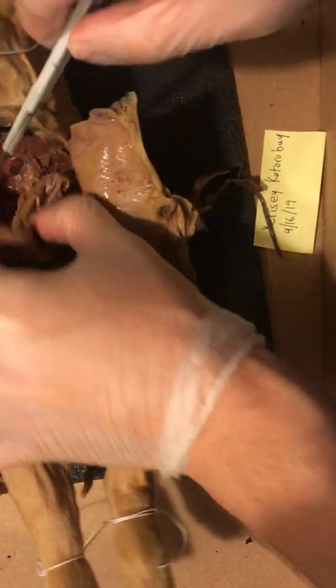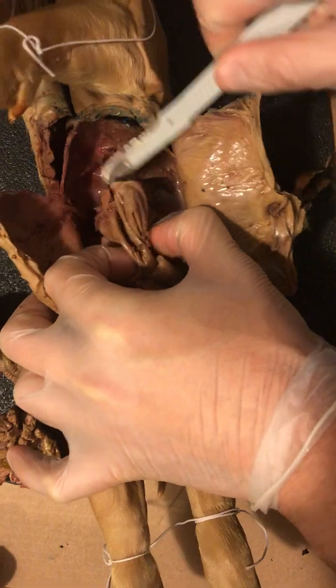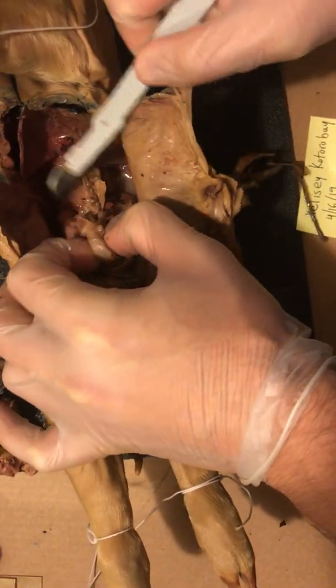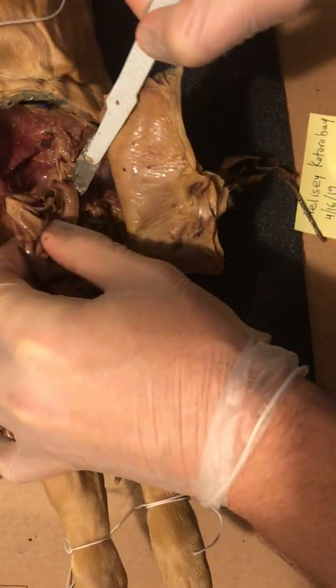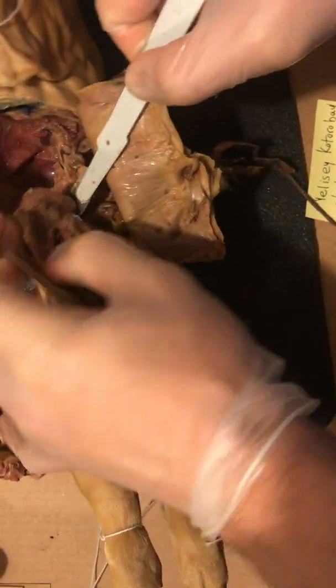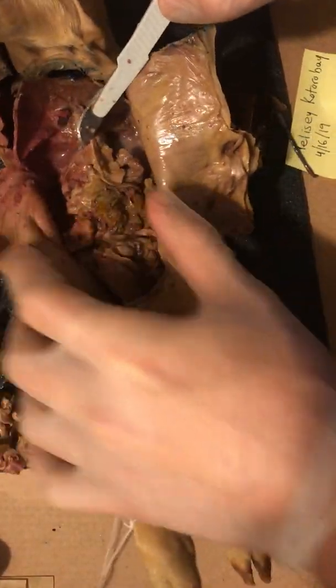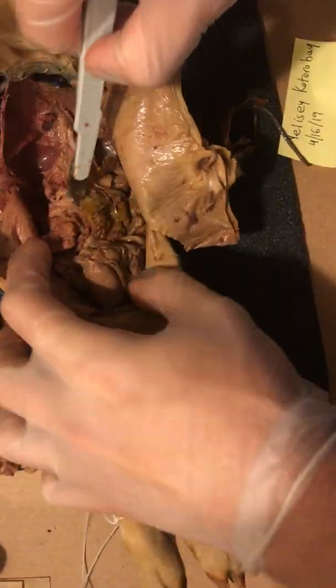Okay, I'm gonna keep going. Okay, gonna keep going here.